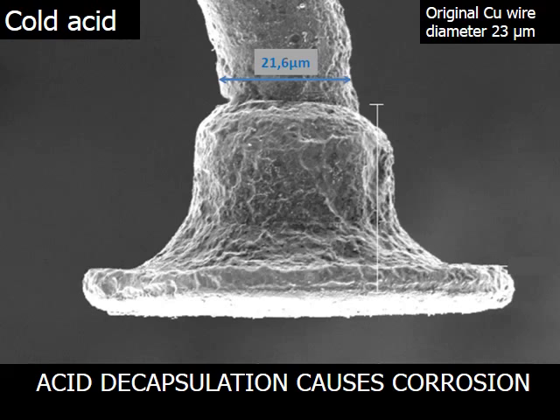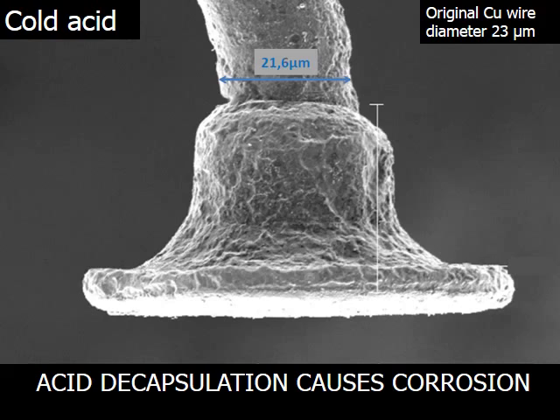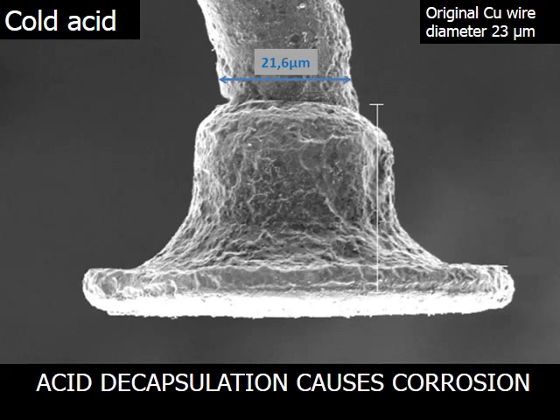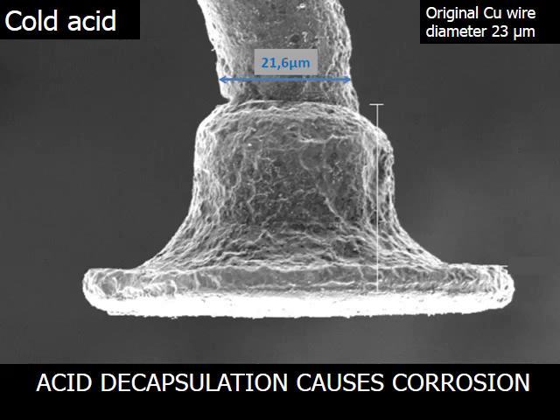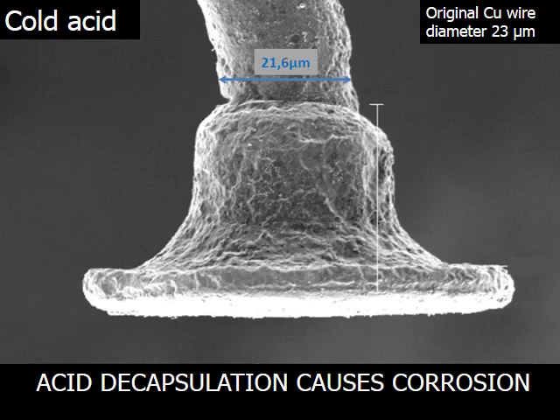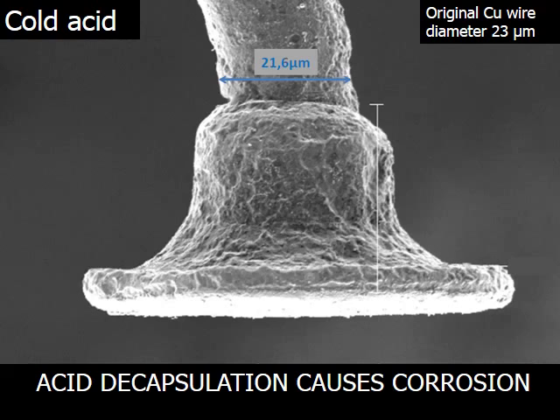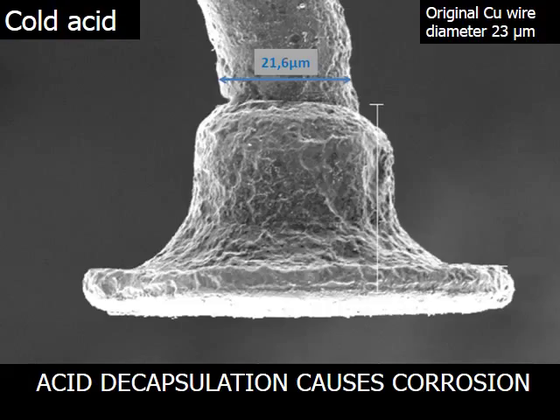Thermal stressing of a sample during quality control processes hardens the epoxy moulding compound, increasing the difficulty for cold acid to decapsulate the sample. The result is that the copper bond wires are exposed to the acid for a longer period of time during decapsulation, creating inevitable corrosion and damage to the copper bond wires.